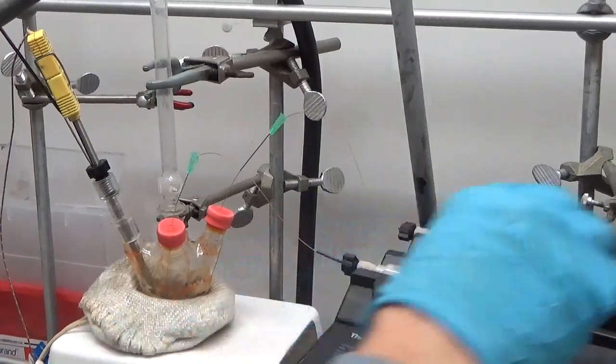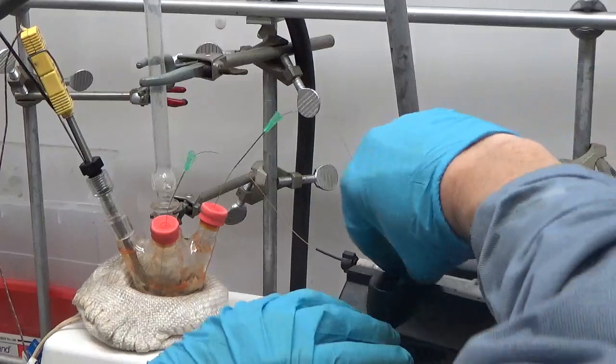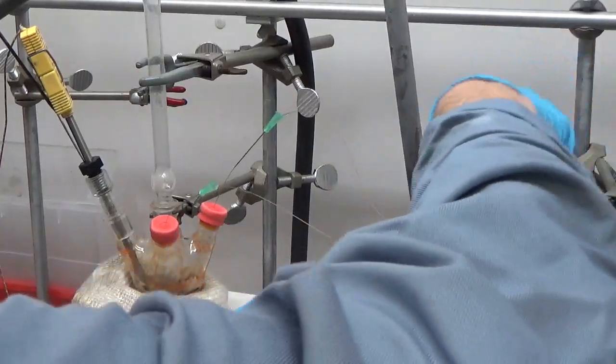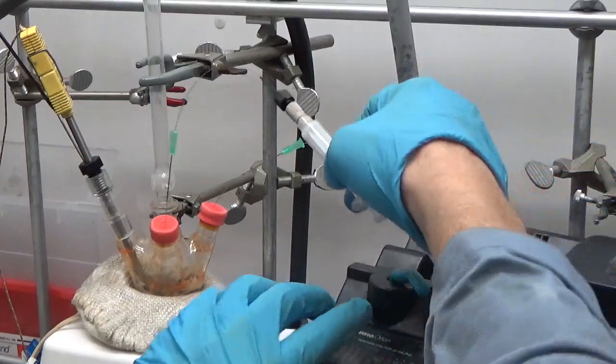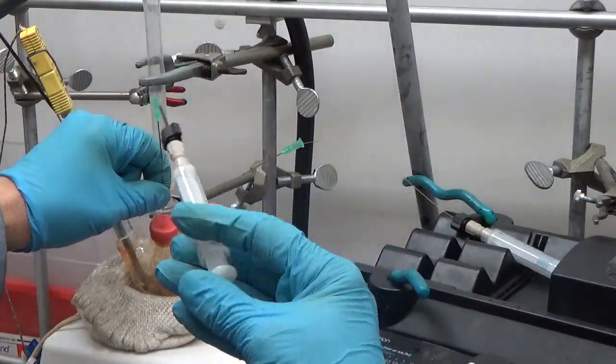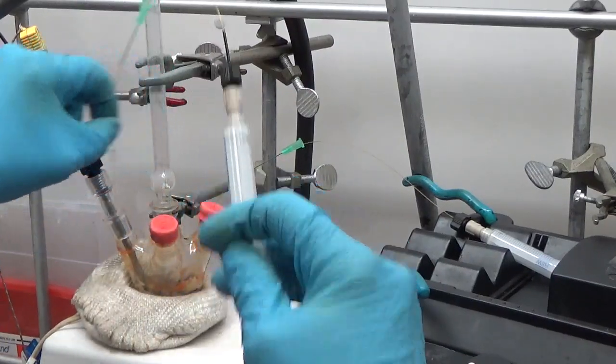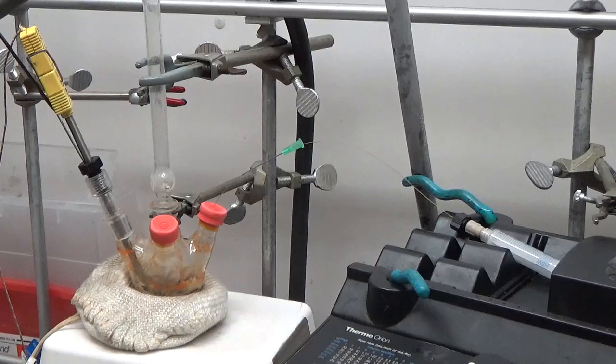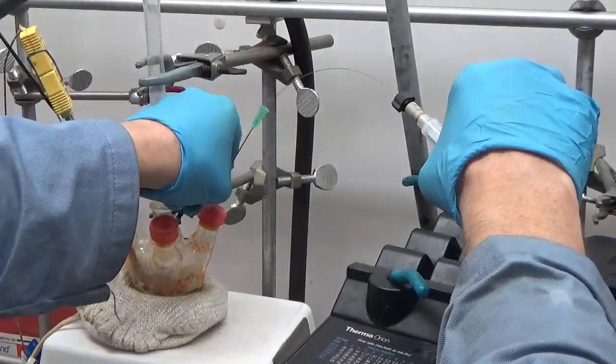We're done with the solution, so I'm going to cool the solution down to room temperature and pack it up. I also know how many QDs there are in that vessel, so I can weigh the amount of growth solution and know how many QDs there are per gram growth solution. I'll do that when I make water-soluble dots for bioimaging.